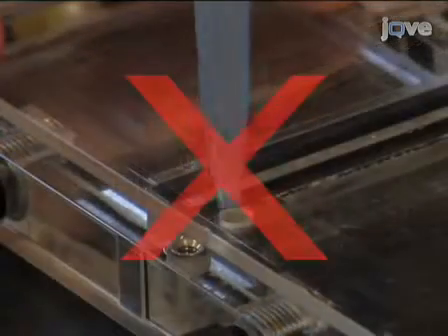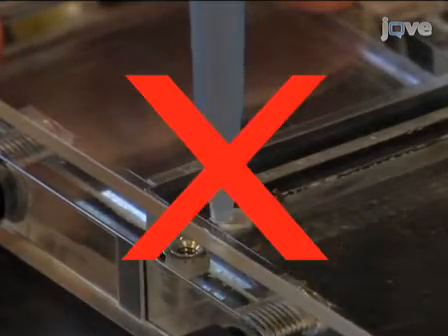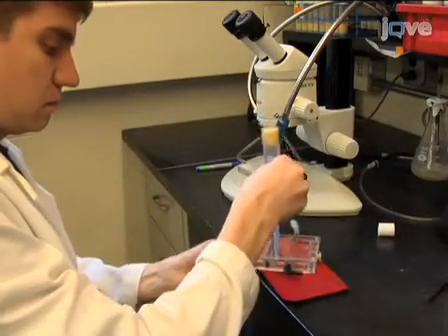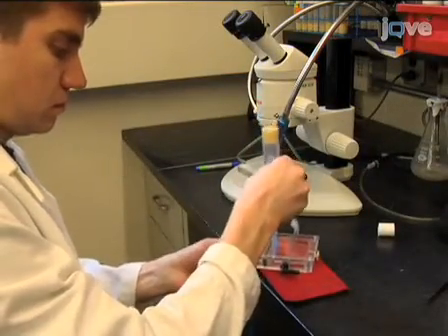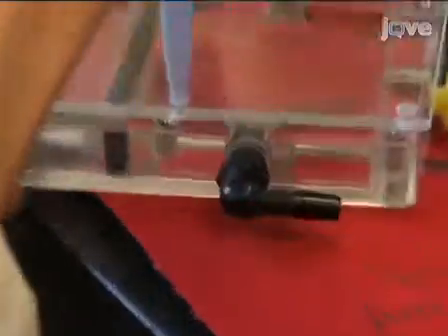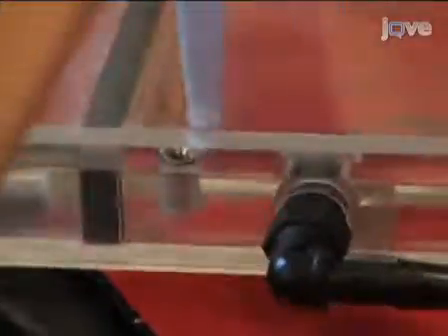Do not move the funnel, as this could hurt or damage the flies. Instead, gently bang the whole chamber, funnel and all, until all flies are inside the chamber. Use a mouse pad to absorb the shock of this banging.